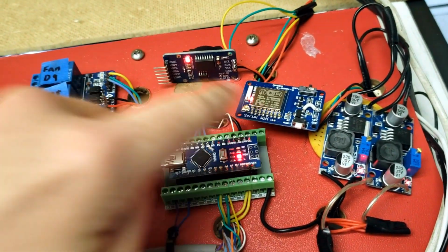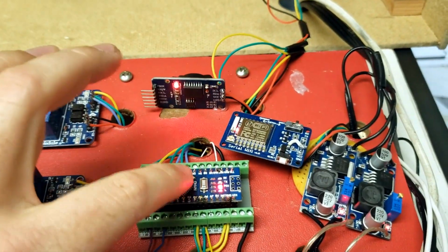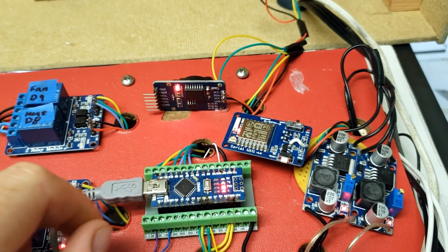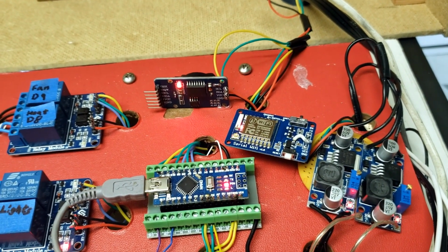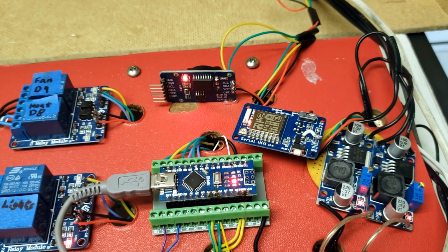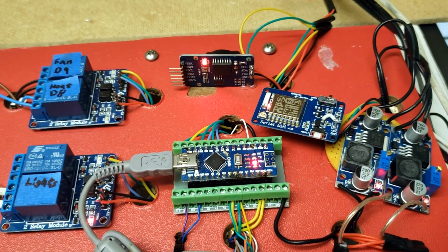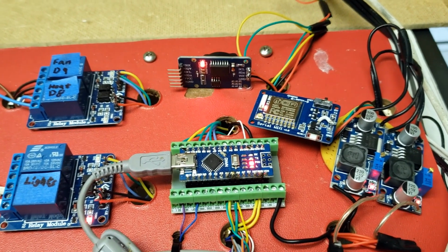Over here, I have the Wi-Fi module, and that's a serial module. So the Arduino outputs serial data, and then this will read the data and upload it to a cloud server. And I think ThingSpeak is the cloud server I'm sending to. And every once in a while, you might see those lights flash, and that's whenever the Wi-Fi is being updated.